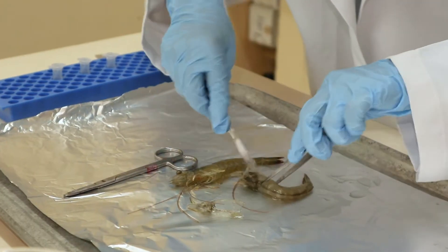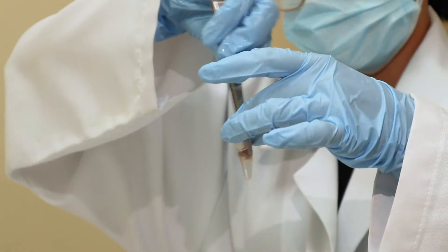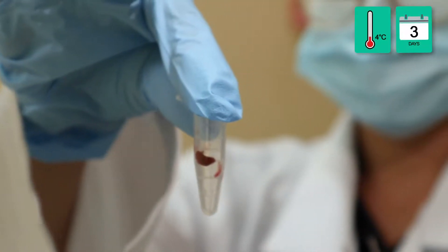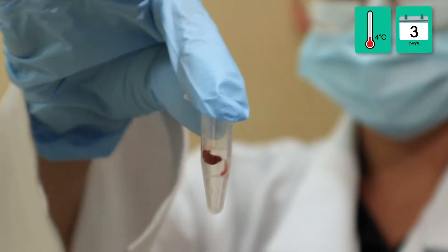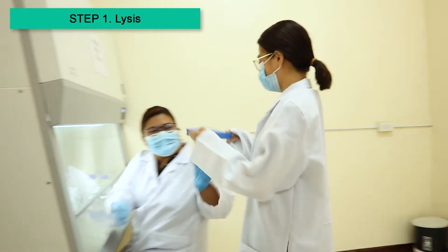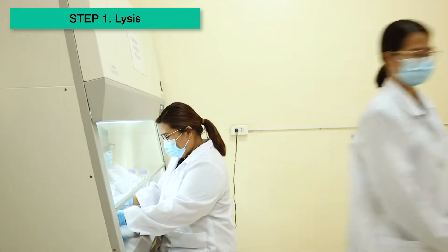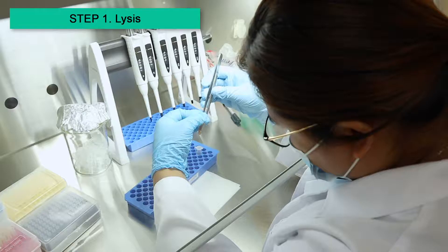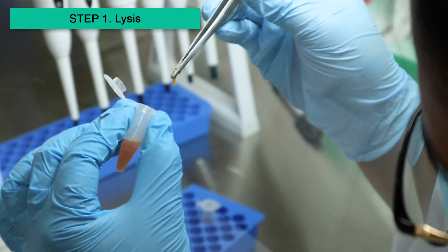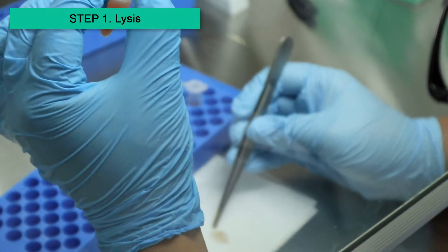50 mg of tissue will be dissected out and placed in a stabilization solution, which can be stored at 4 degrees Celsius for up to 3 days. The dissected tissue is retrieved from storage and excess stabilization solution is blotted out.